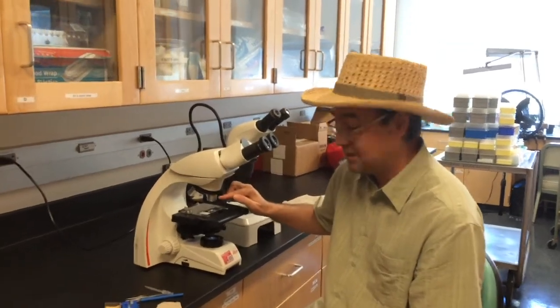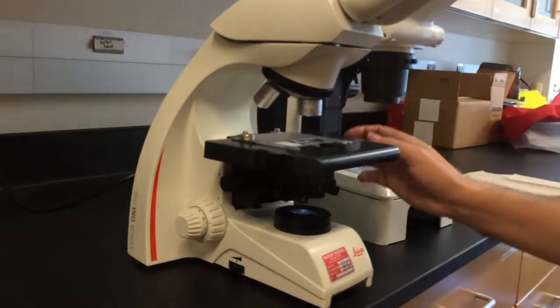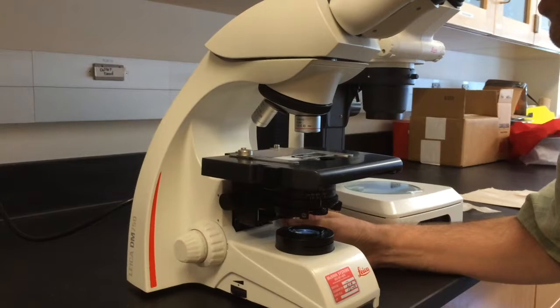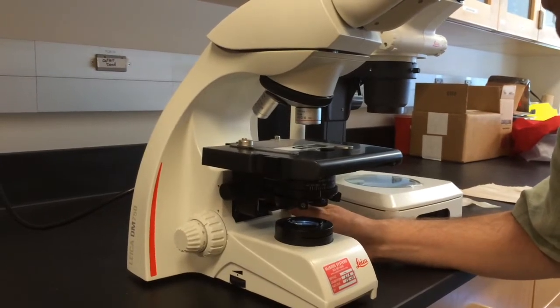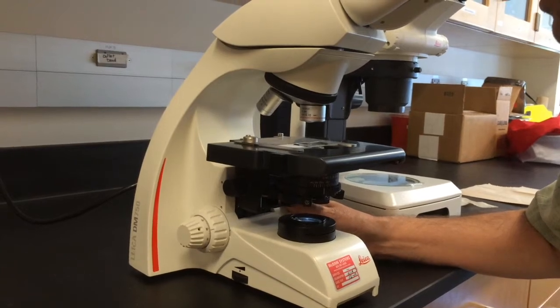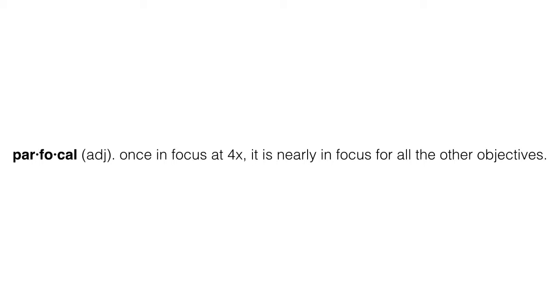The microscope should always start out on a low objective, like this is a 4x scanning. And then you rotate the stage almost to the top, and then back down. So I'm going back down until it's in focus. There we go. And then once it's in focus at 4x, it'll be in focus for all the other objectives.